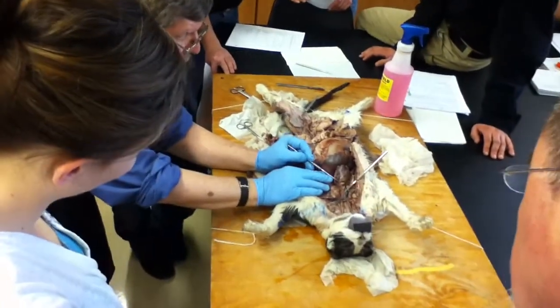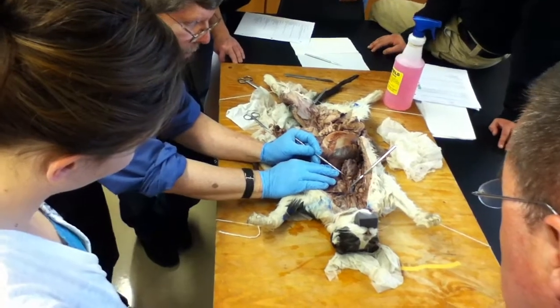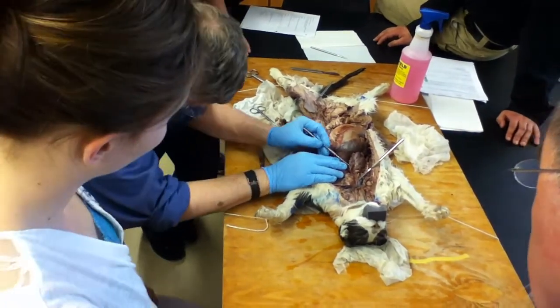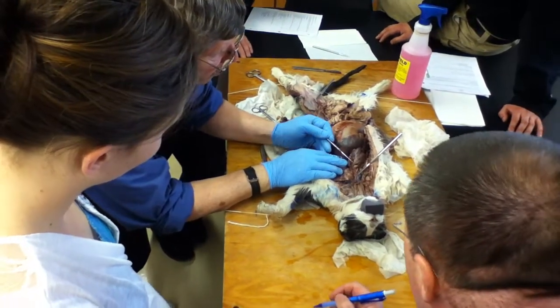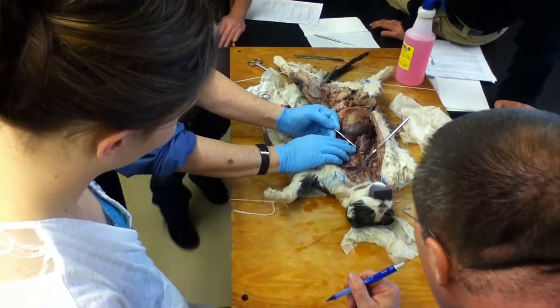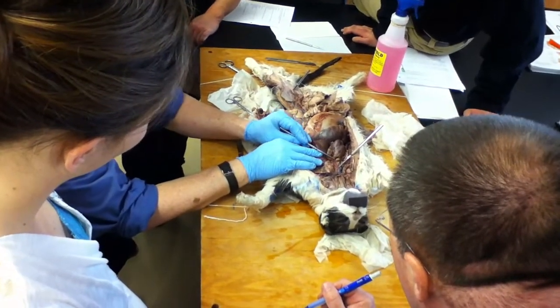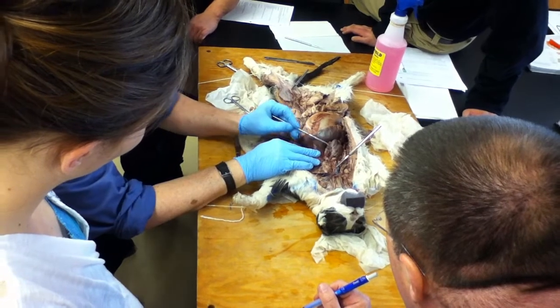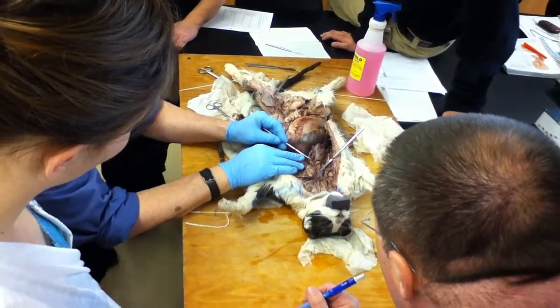That means this big vessel coming out of here would be what? The vena cava. Coming out of the right ventricle, oh, the pulmonary artery. Pulmonary trunk. That's right. I mean, it looks really big, and that's just the way it's preserved. See it right here? Oh, okay. So that's a fat pad. That right there is what I'm talking about. That's the pulmonary trunk. Okay.